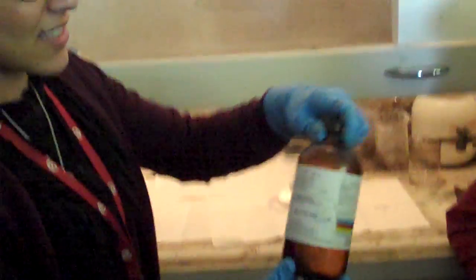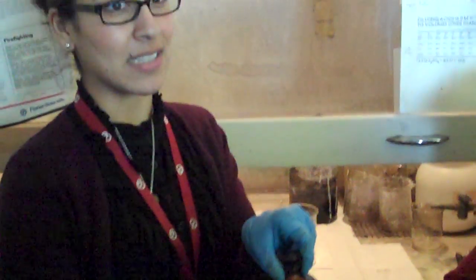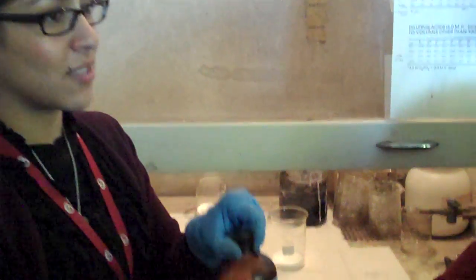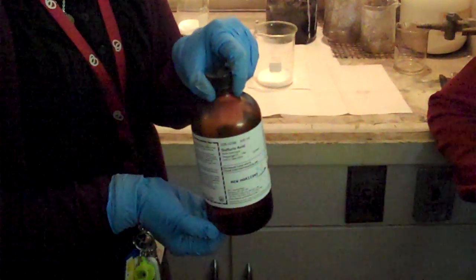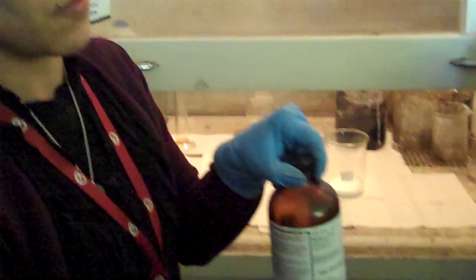This is 18 molar sulfuric acid. That's freaky because I usually get nervous working with one molar stuff or six molar stuff. This is pure sulfuric acid.